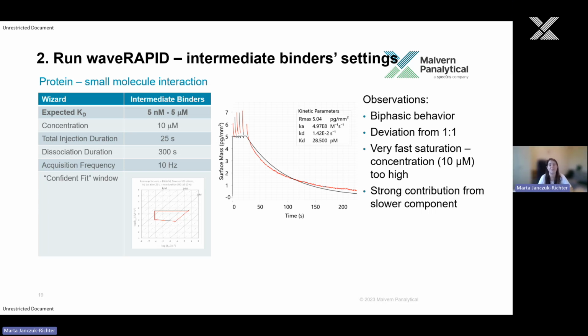So what we see here is there is some biphasic behavior. There is a faster and slower component here, so it deviates from the one-to-one model. There is very fast saturation. So this 10 micromolar is definitely too high a concentration for this. But it looks like it's really much tighter than we expected.